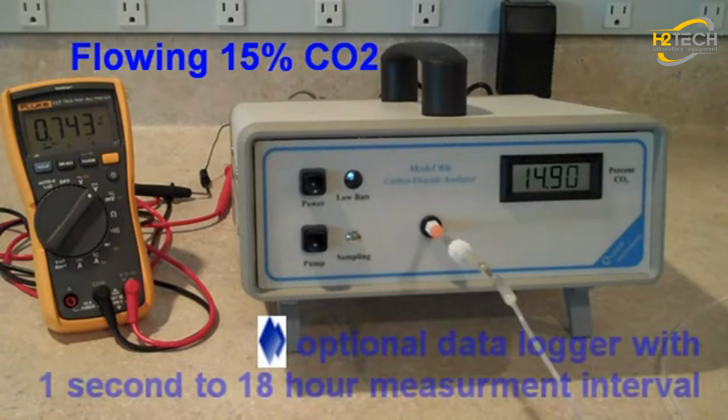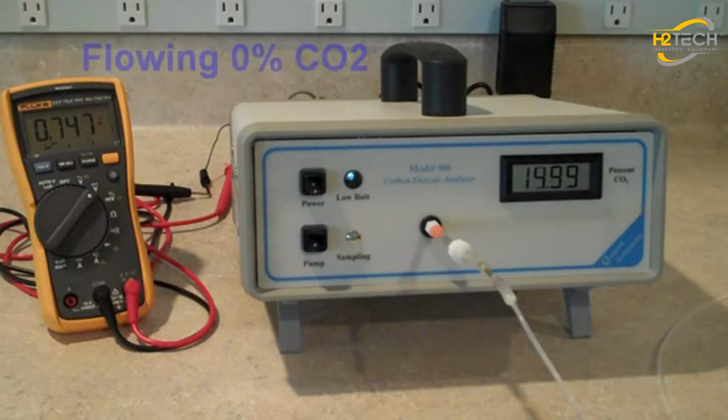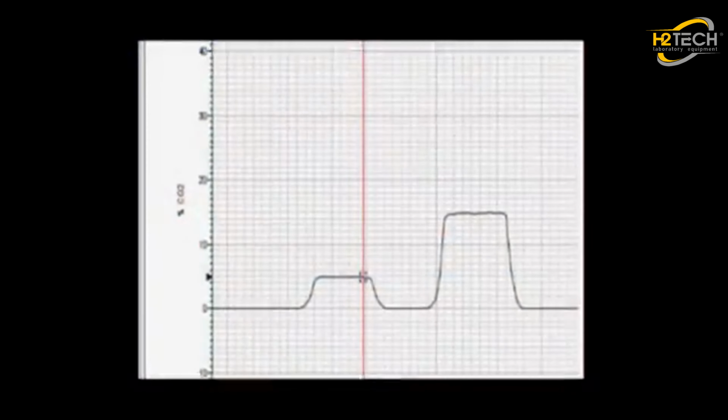Now we can provide this analyzer with a data logger, which will record measurements at a rate of 1 per second or 1 every 18 hours and can record up to 40,000 measurements. This data logger is optional and can be provided to you should you not have your own data acquisition equipment in your lab. And finally, we're going to flow pure nitrogen through it to get the analyzer back down to 0. Now let's take a look at the software.